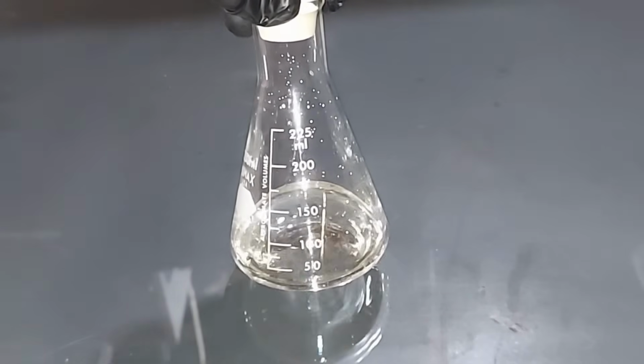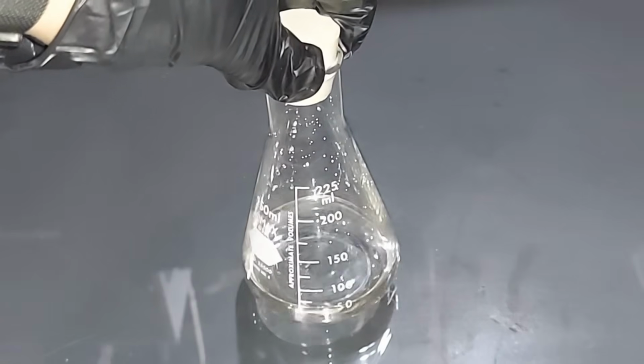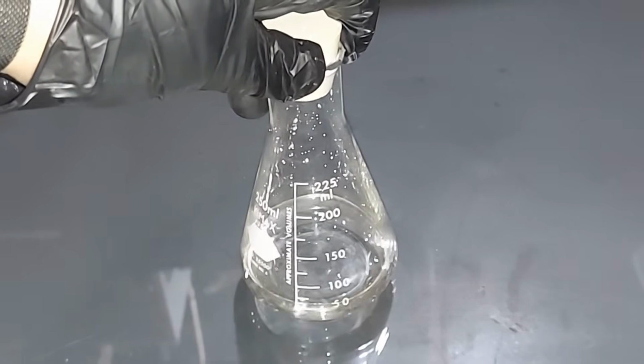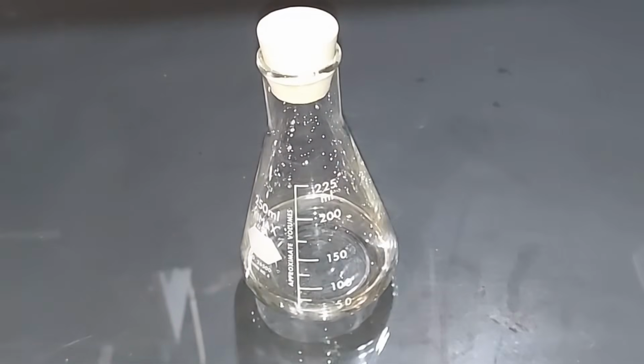And that's another reason why you don't do this, to get around 65 milliliters of sulfuric acid at 67% out of 2 liters of solution that we started, just to drive home the point. Once again, this was just to watch the chemistry, not to actually make a lot of sulfuric acid.